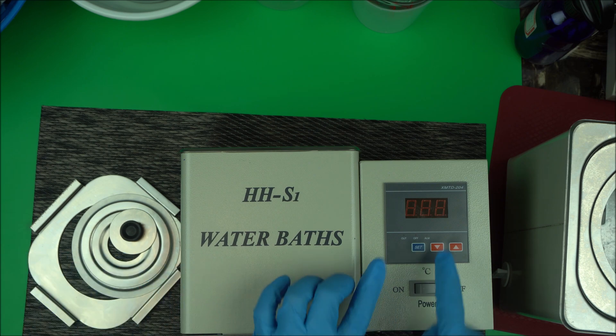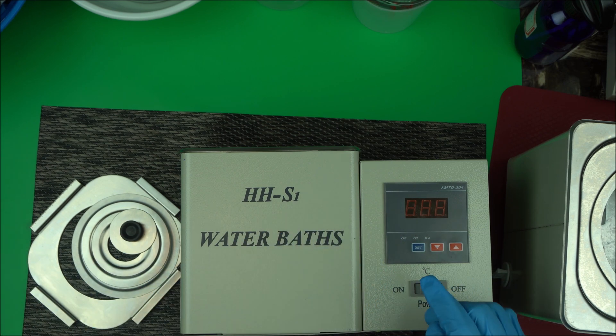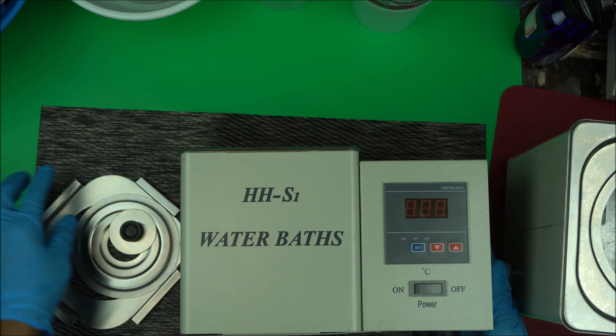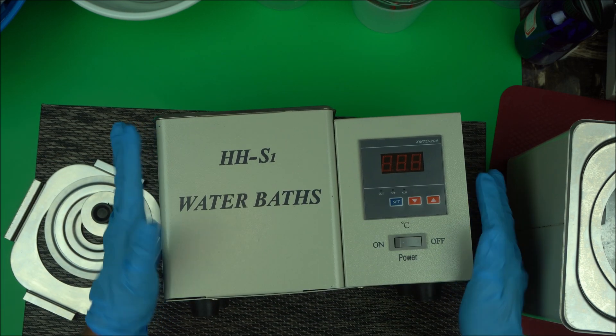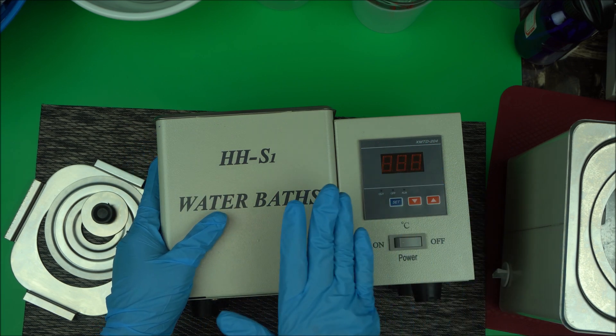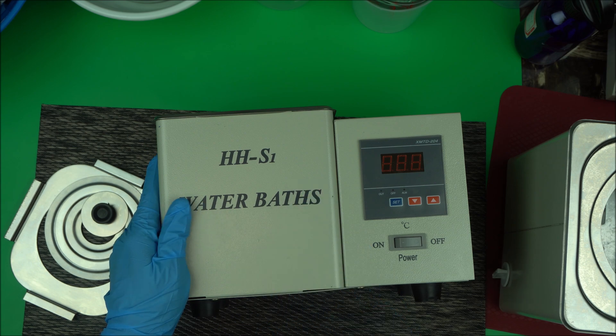Use thermostatic water baths, water baths that have thermostats where you are able to control the temperature up and down. It's a good thing to start with.